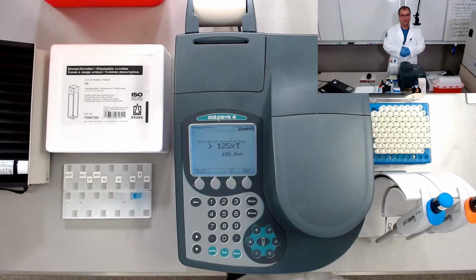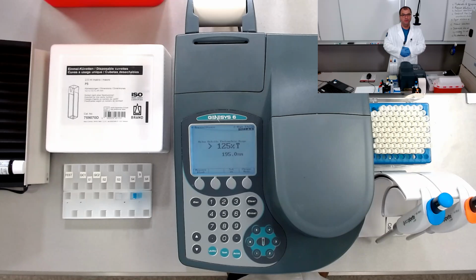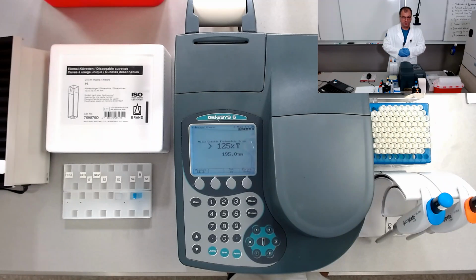Hi, I'm Costel. In this video, I'll show you a high-performance procedure to determine the absorption spectrum for an analyte. In our case, we chose to use total protein reagent.